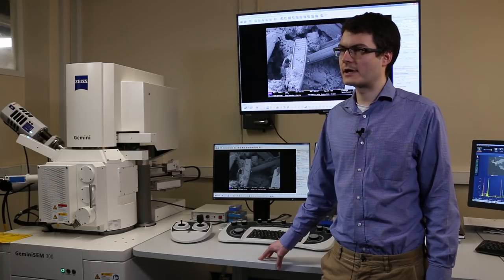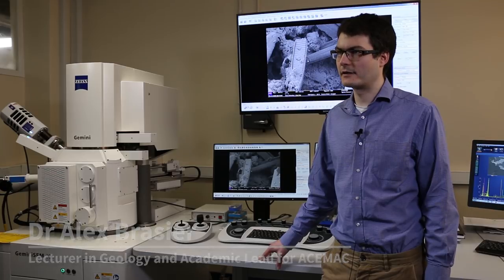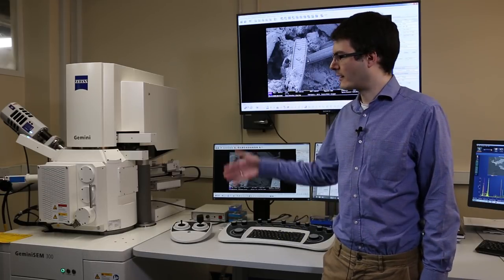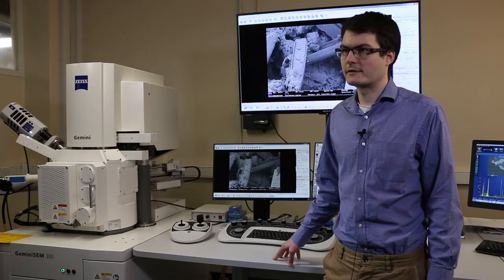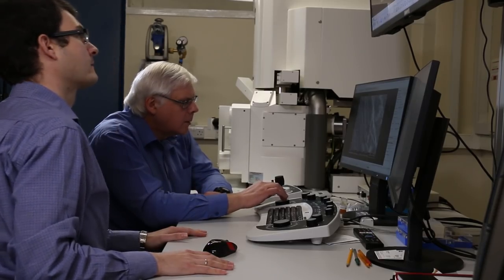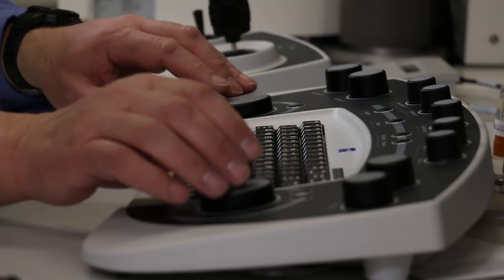The University has several different electron microscopes. It's got a couple of them up at Forrester Hill and the Institute of Medical Sciences, and we've got this one down at King's College. This is the ACEMAC facility — the Aberdeen Centre for Electron Microscopy Analysis and Characterization.